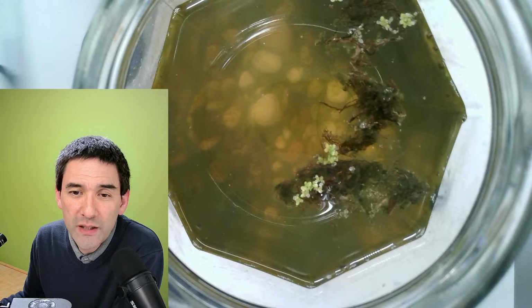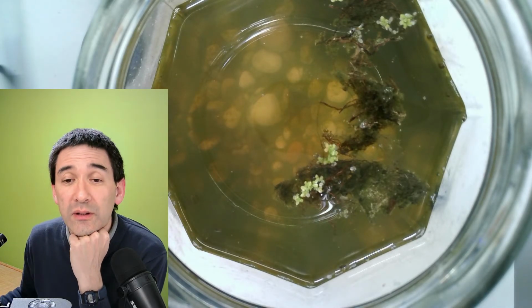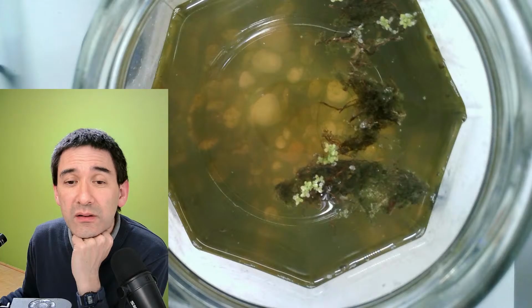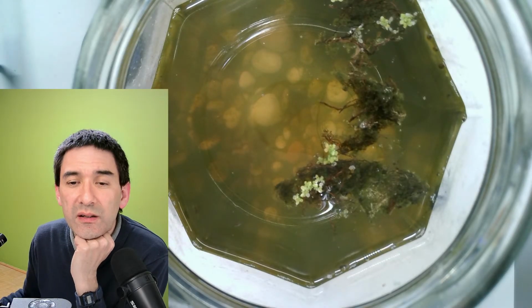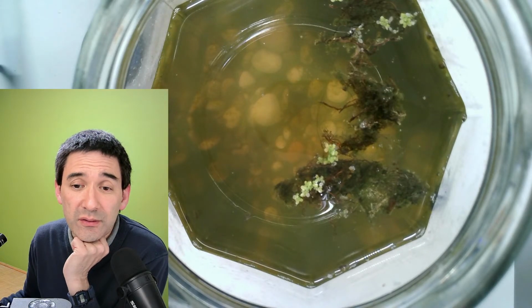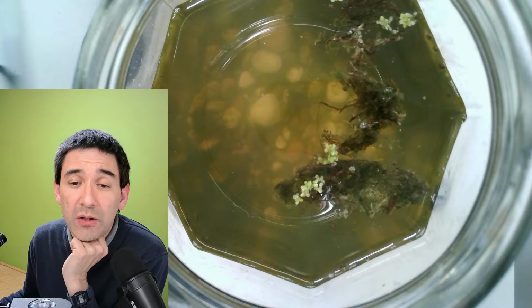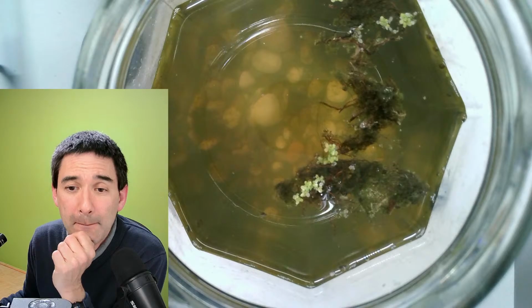So I'm just reading. Oliver Wood: off-axis dipole illumination, like used in lithography, to minimize the XY distortion when Z-stacking. I don't know about that. That's an interesting one. Because when you're stacking together, you're also introducing artifacts.